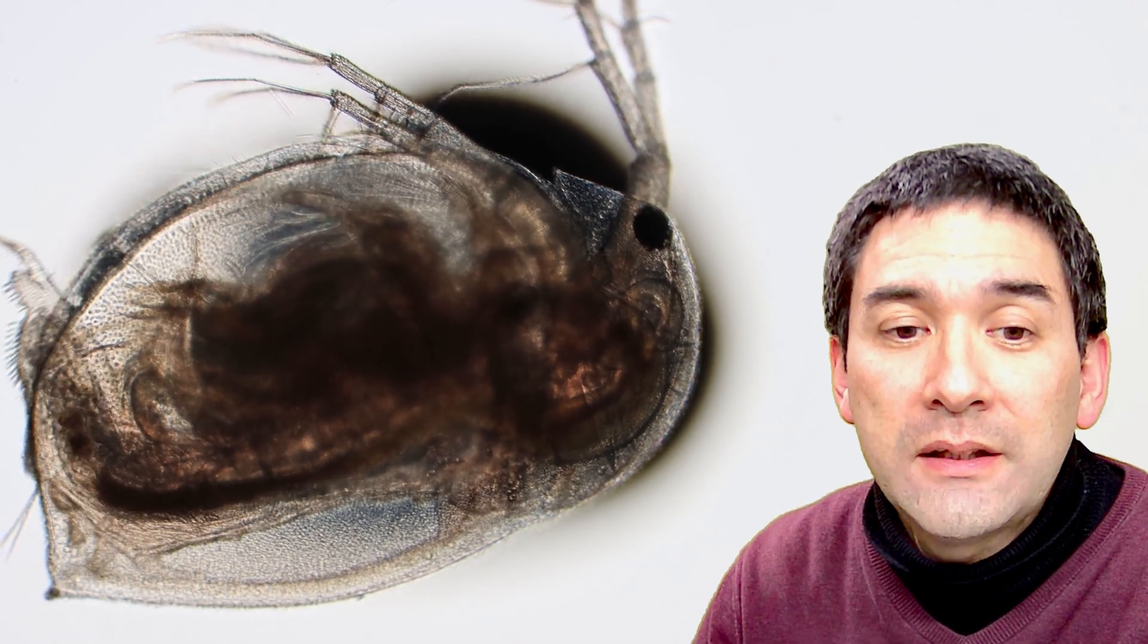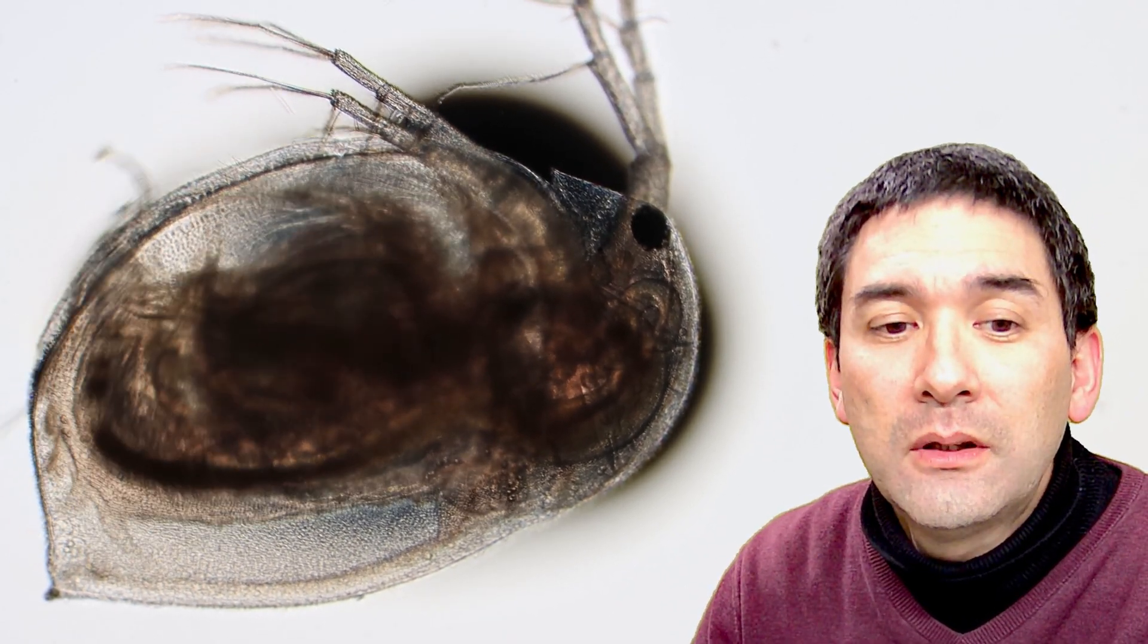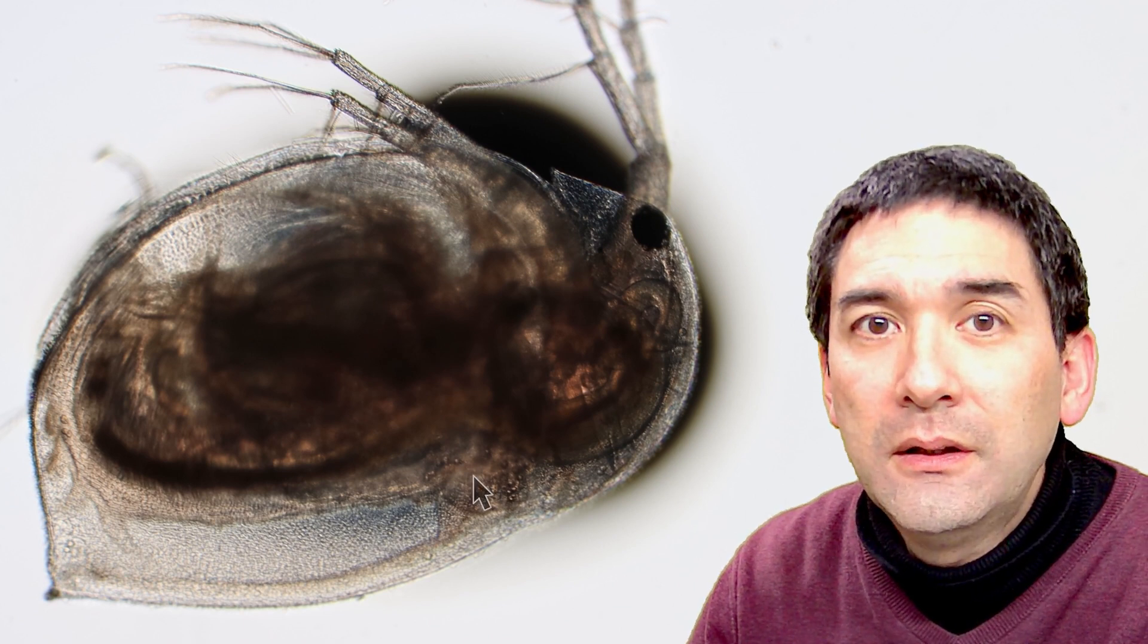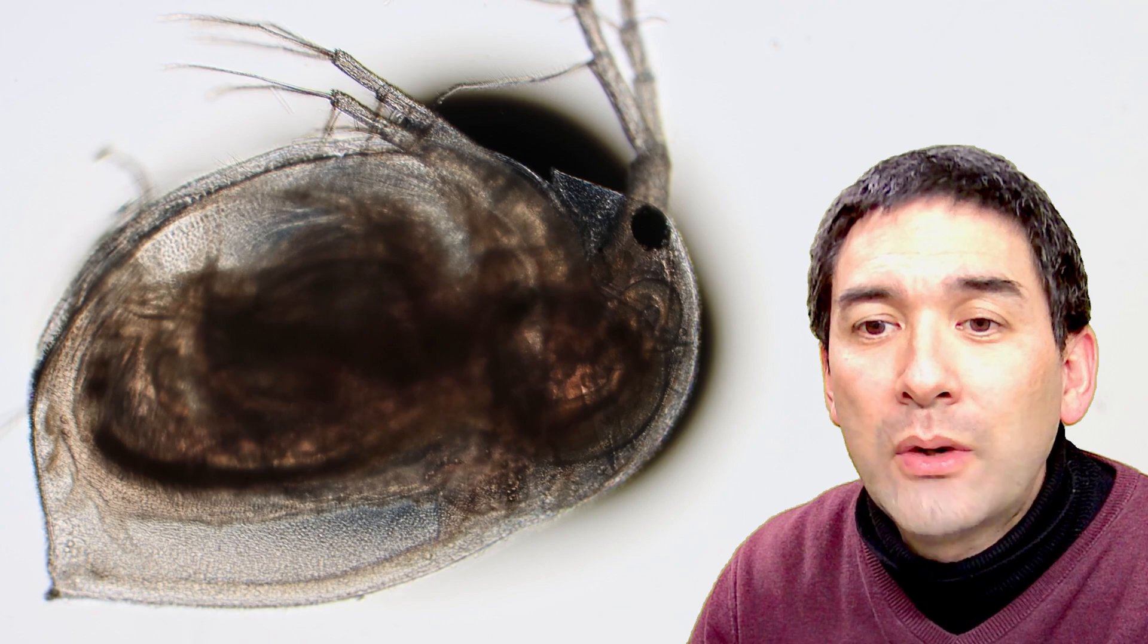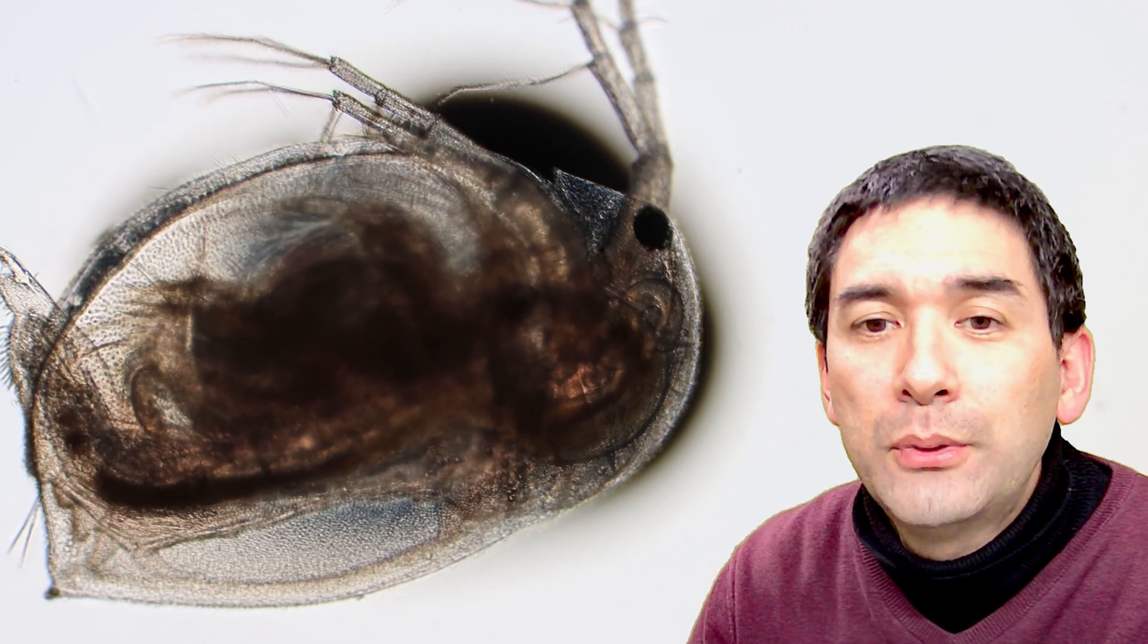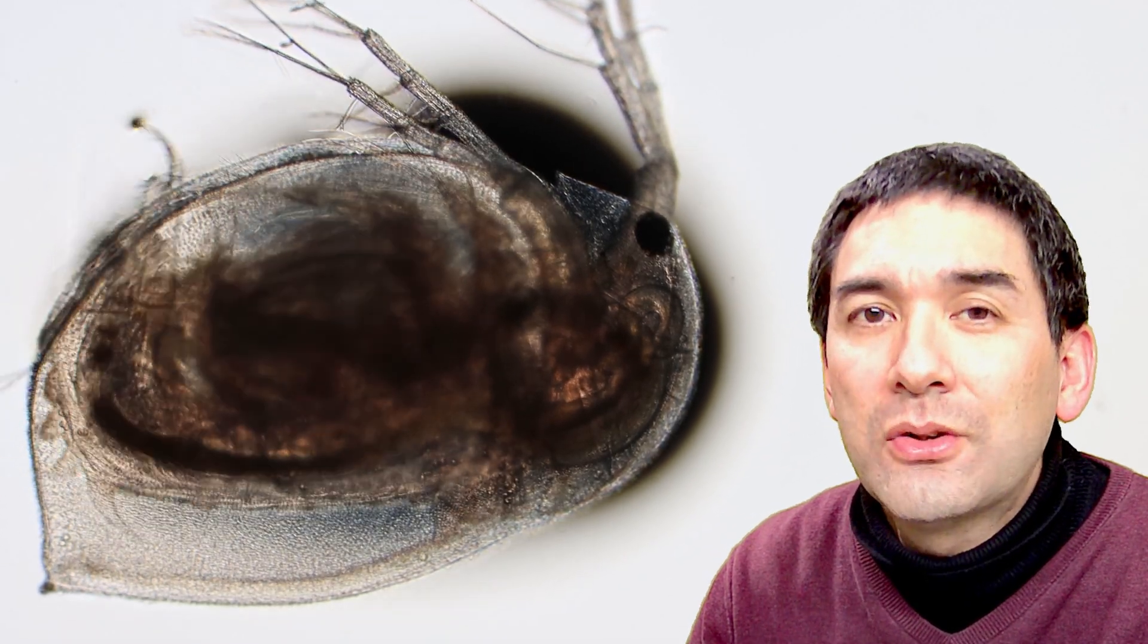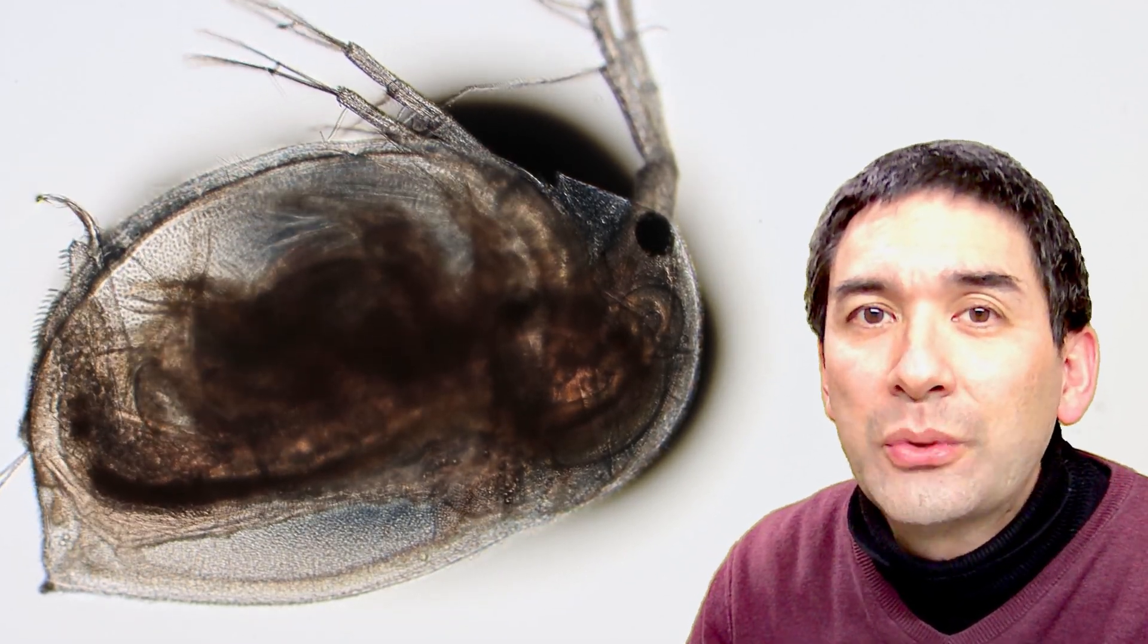And look right now, look at the speed, look at the speed of the heart right now, and then see what happens when I add more alcohol. Okay yeah, you see it's pretty fast, and then I'm adding more alcohol and then it starts to almost immediately start to slow down.